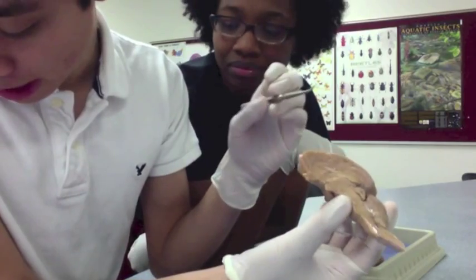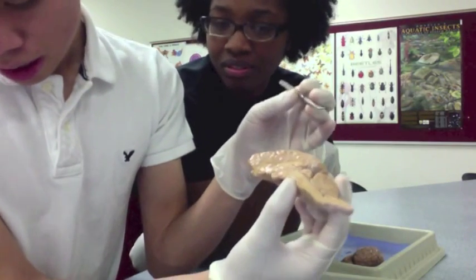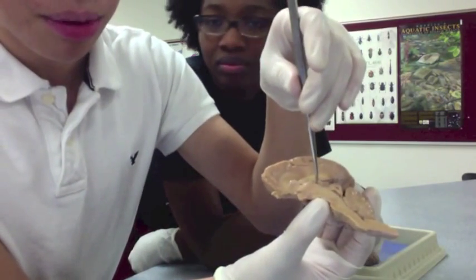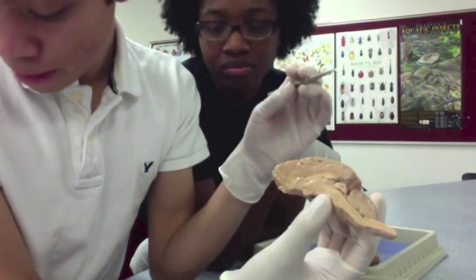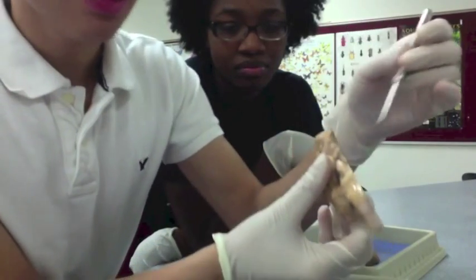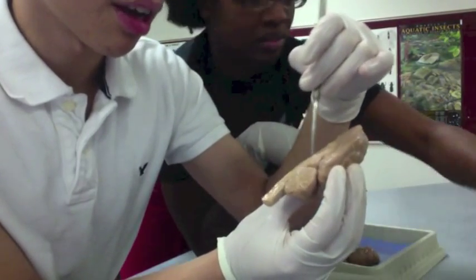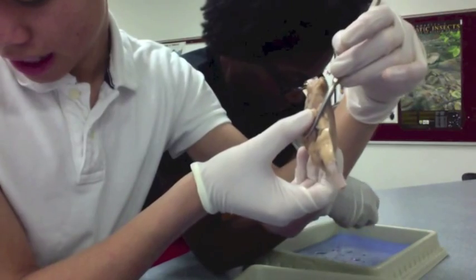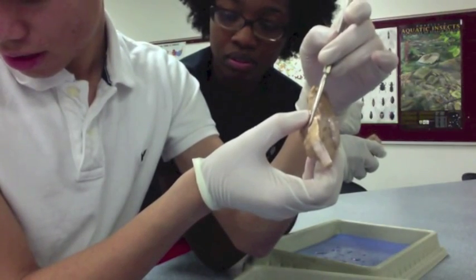The optic chiasma is the thing that comes off there. Next you have the intermediate mass of the thalamus, which is the point right in the middle of your thalamus — there's a little point right there in the middle. You have your cerebral peduncle, which is this section right here, like where your pons area would be.